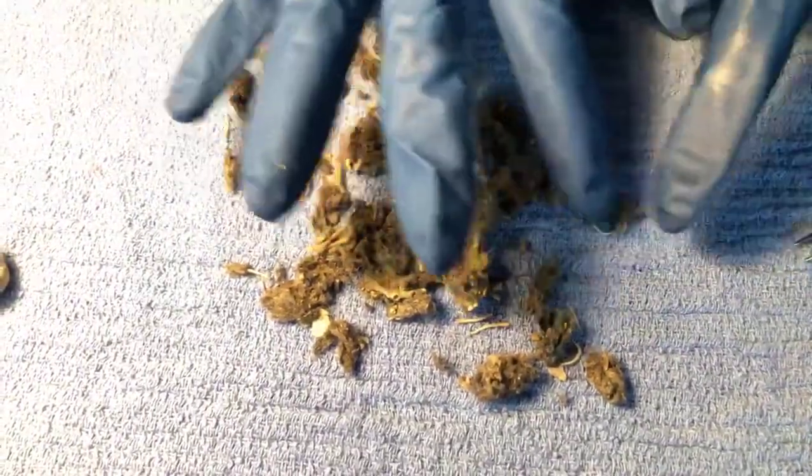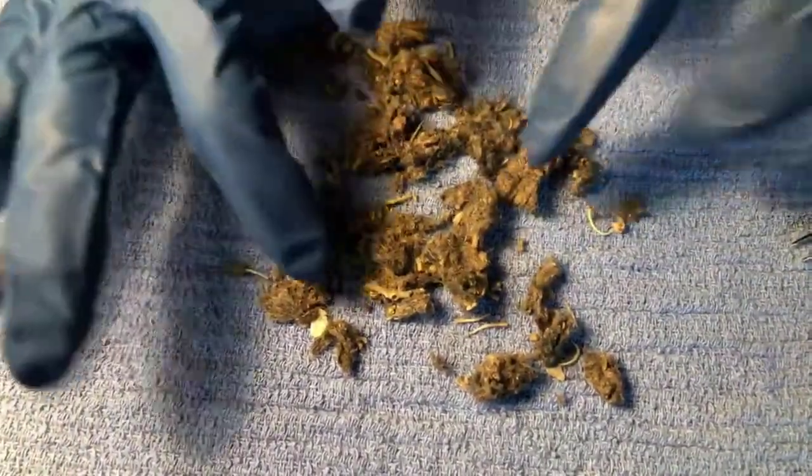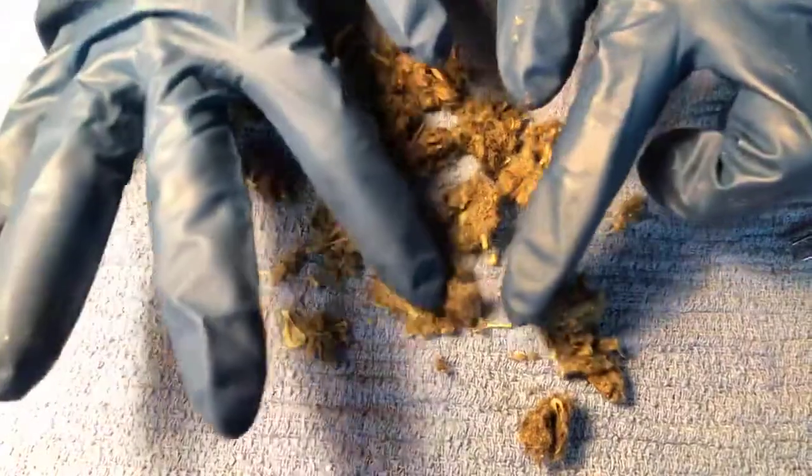Mostly, I mean, that's a rib. Clearly that's a rib right there. This looks like some sort of hip bone. Hip bone or scapula or something. Scapula, yep. So again, different. Oh, there's another one too. That one looks really neat.